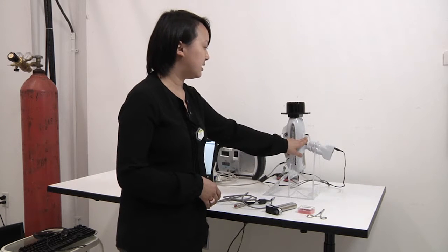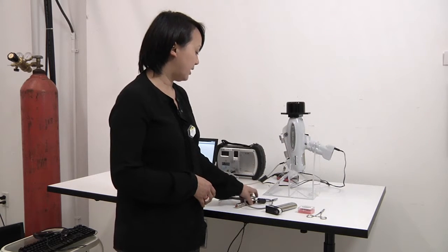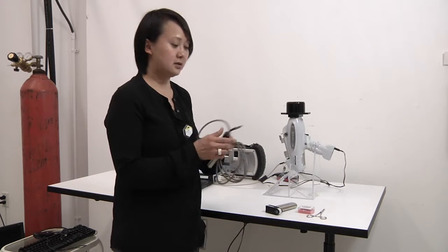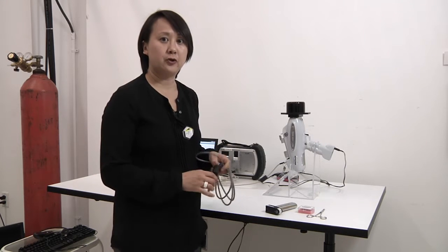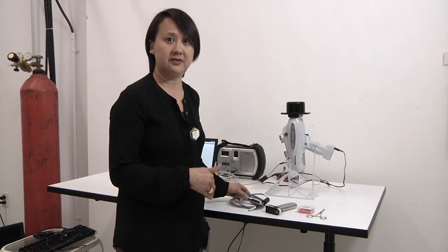The first way is on the handle, the second way is the remote trigger, and the third way is the software based PC trigger which we will talk more about in this session.